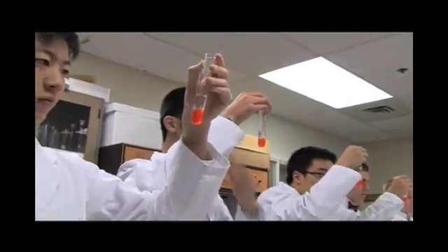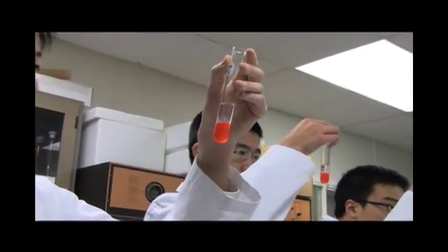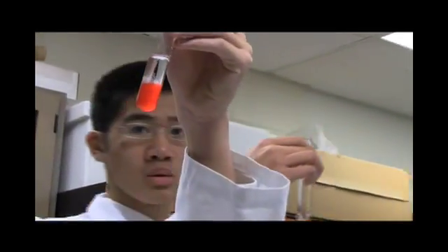You'll start to see the DNA coming out of solution at the interface. Those are strands of DNA.